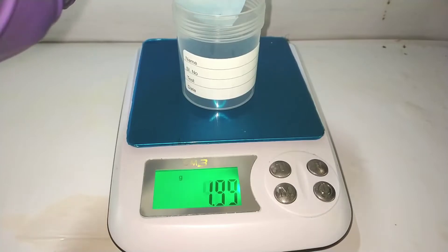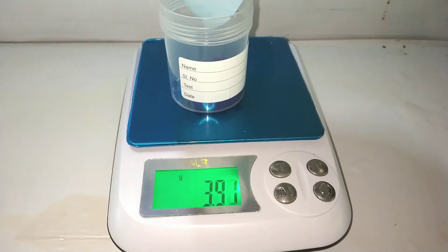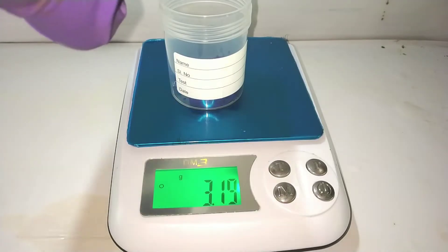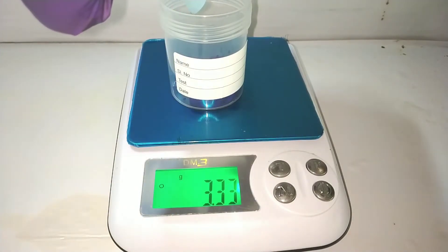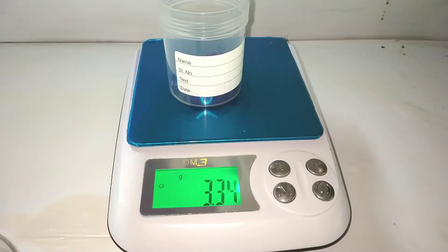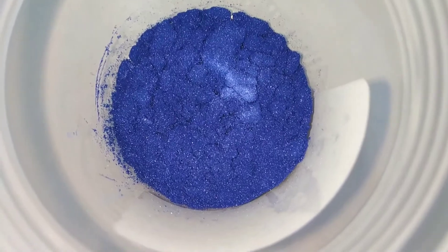It was then transferred to a storage bottle and weighed. The total weight came to about 3.34 grams. It was then placed under the sun for a few minutes. Here is one final look of the crystals.